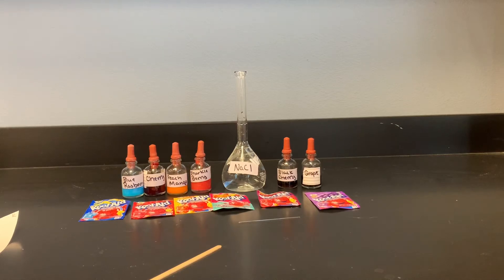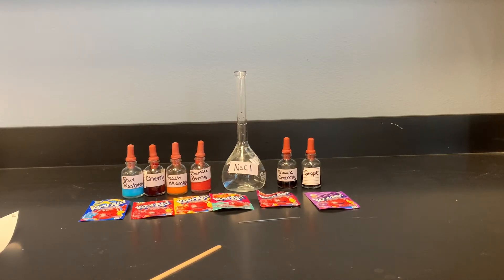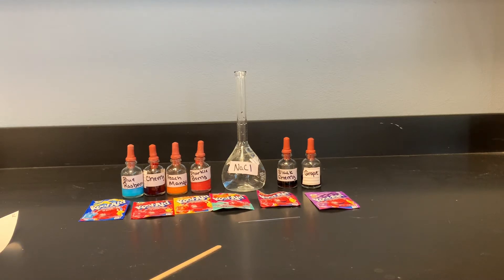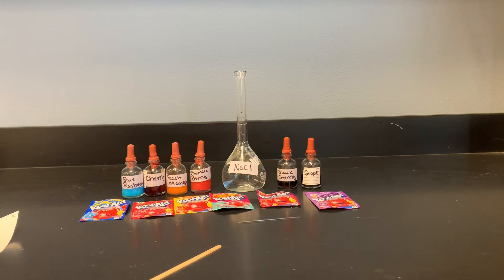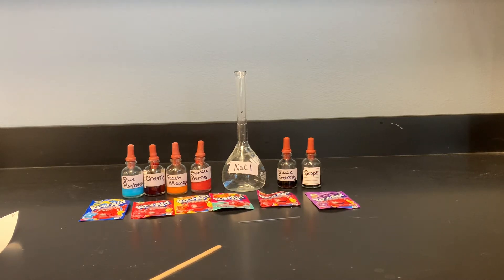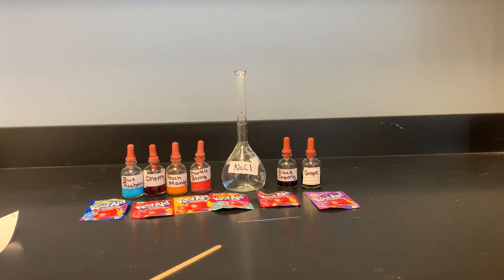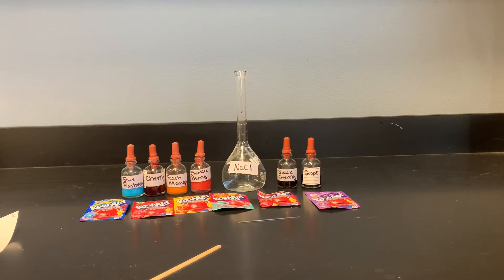This is AP lab number five: separation of molecules. We will be using Kool-Aid to help us see what is going on. Chromatography is an important technique that we use for various reasons in chemistry. The objective is to separate the food dyes using chromatography.